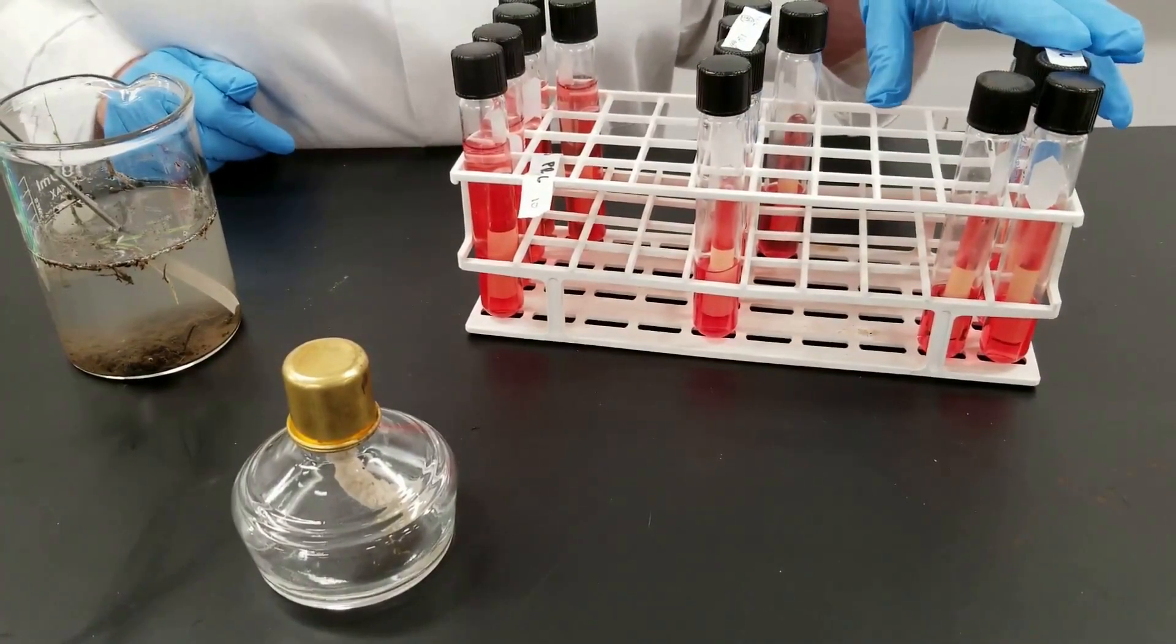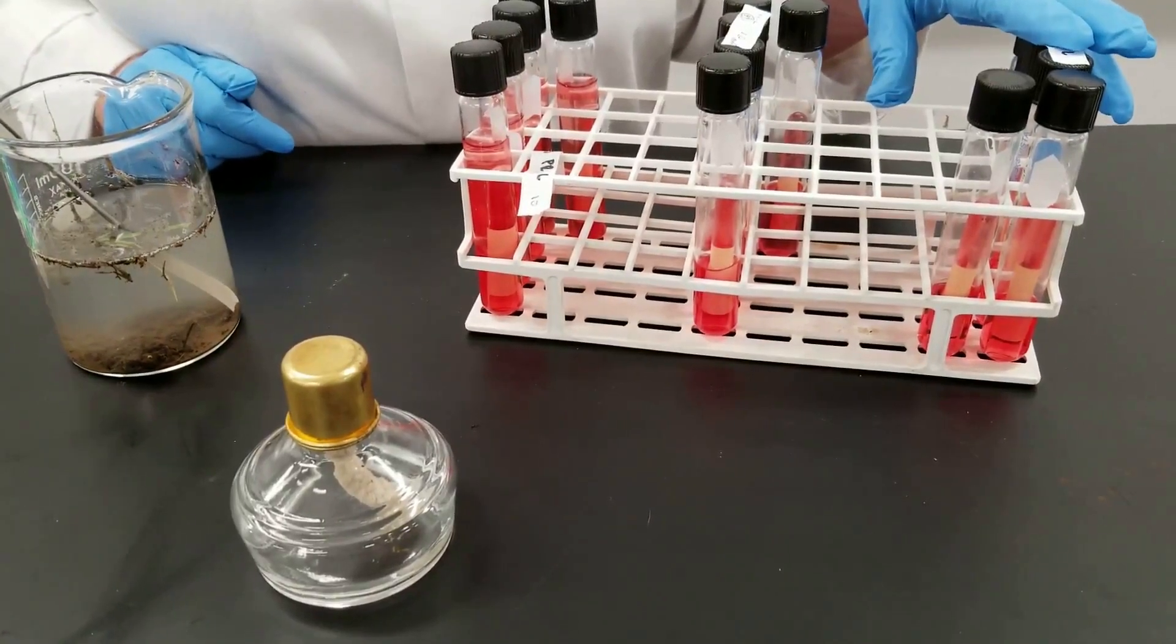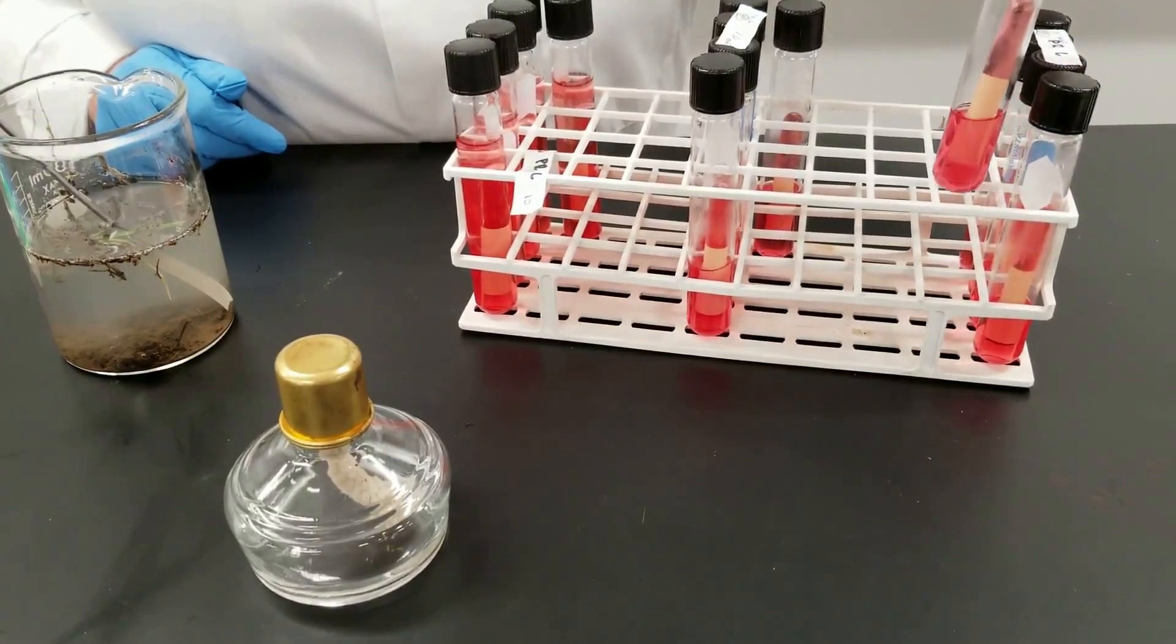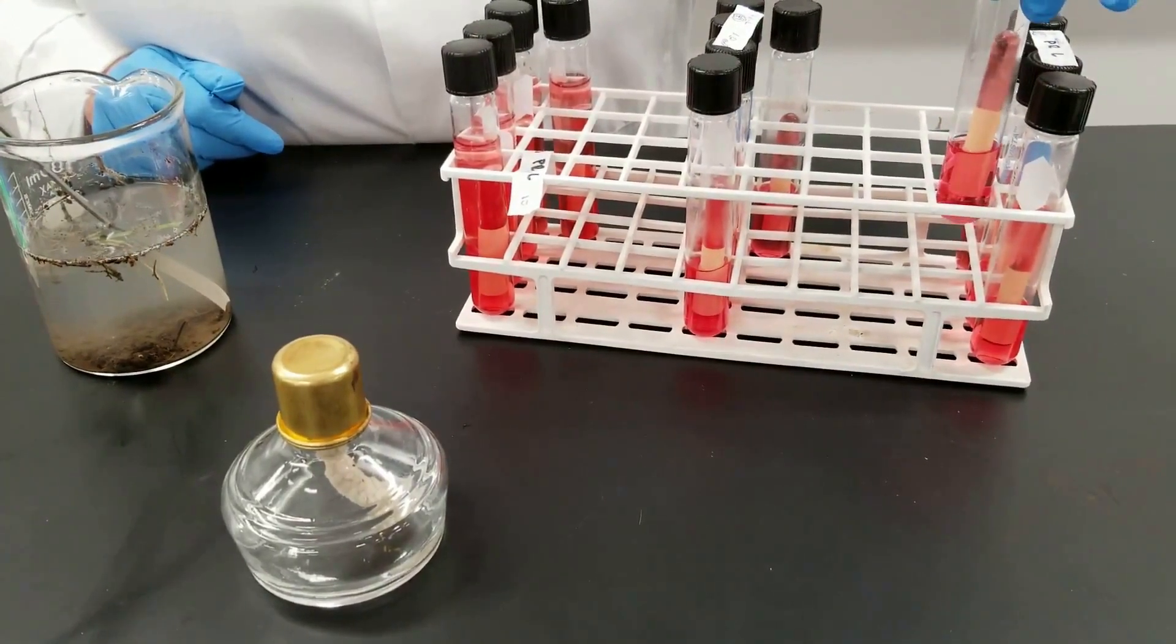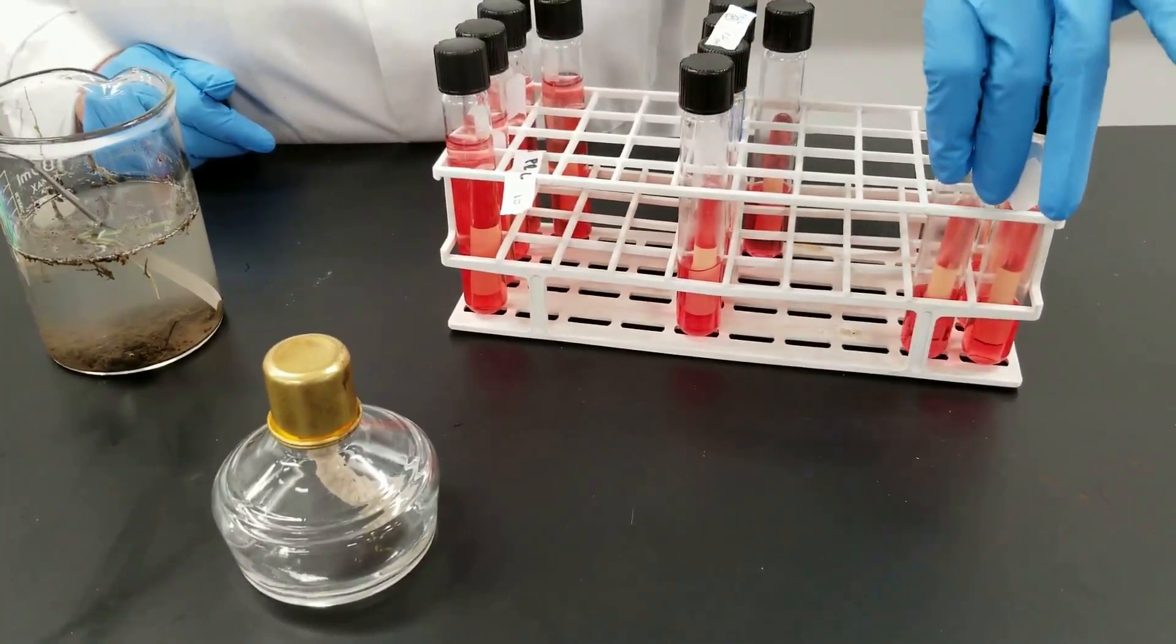We're going to incubate these for 24 hours at 37 degrees Celsius. You can see how it looks like I just inoculated them. They have the Durham tube in it.